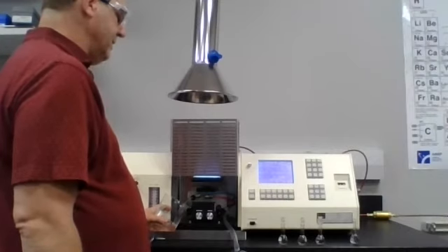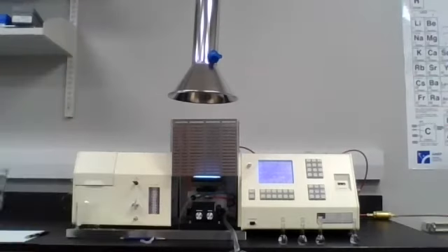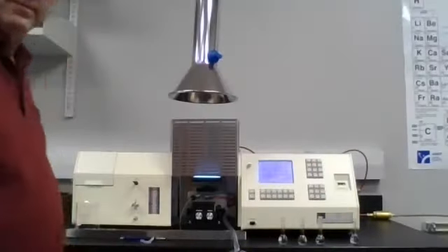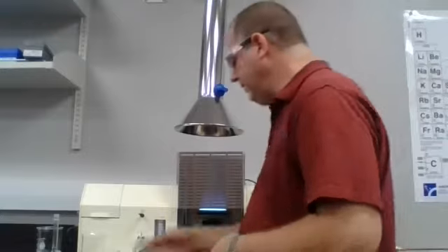Right now I have this at 0, so it's set at 0, and we are going to start measuring some of these with the 1. Just a second here, I've got to make one little adjustment. Okay, so again, I think I paused it when I meant to be collecting data. So we're going to go ahead and do this again.